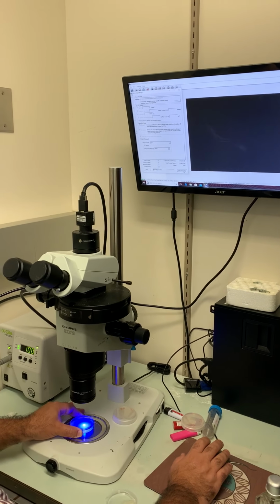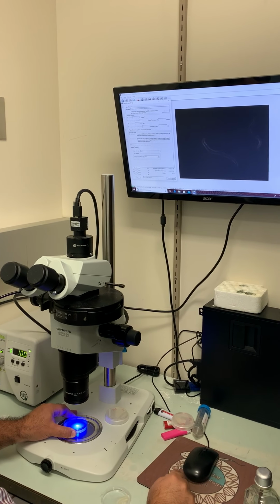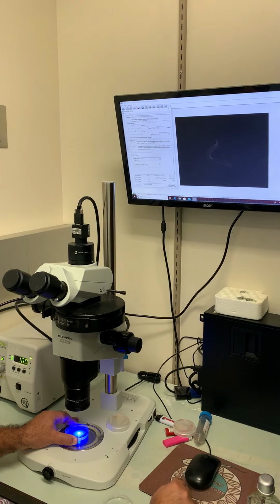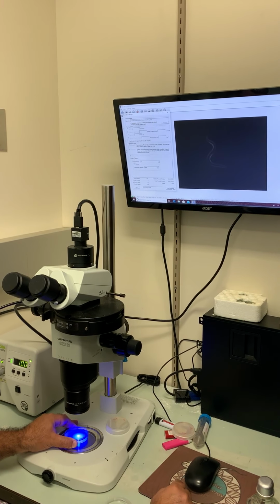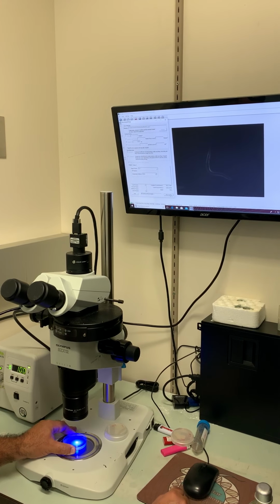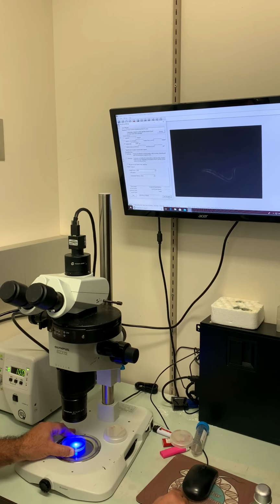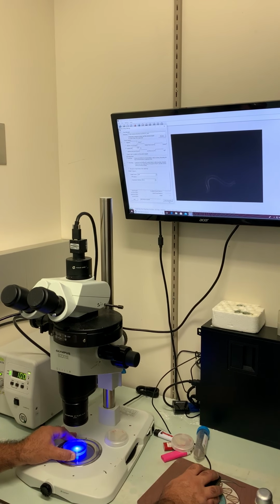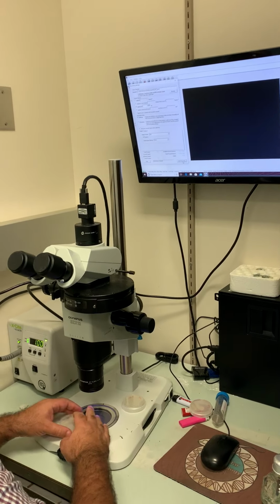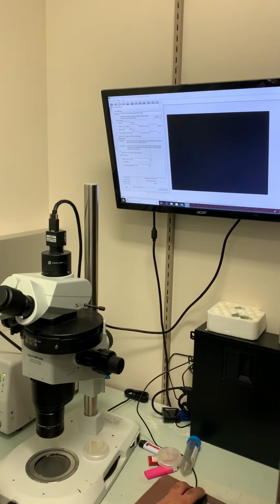And we start recording. And you might not see the worm in there, but it's right there in the middle. It's not really moving anywhere. When it reaches the 15, okay, it already stopped. So I'm gonna close this thing again. Turn the shutter off. And now those files are in this folder.